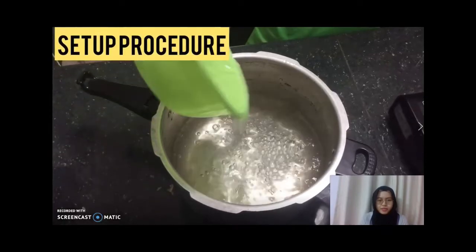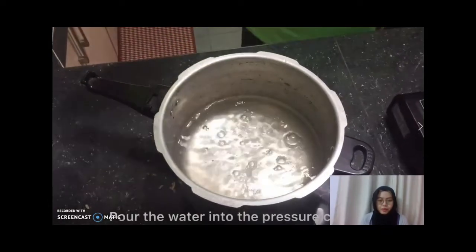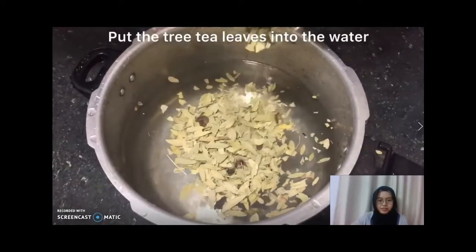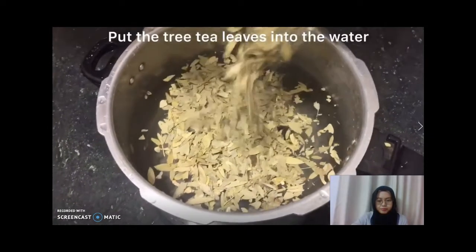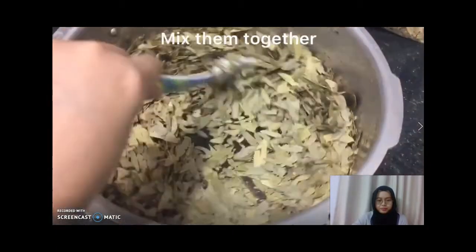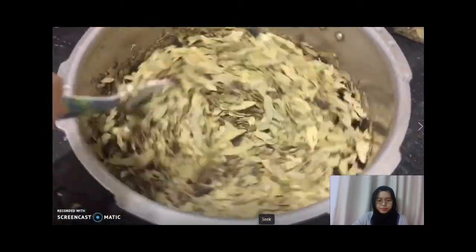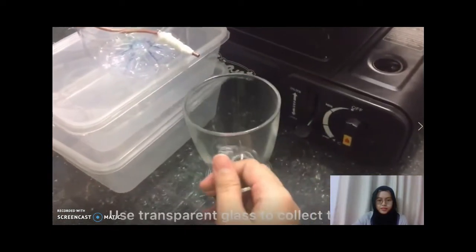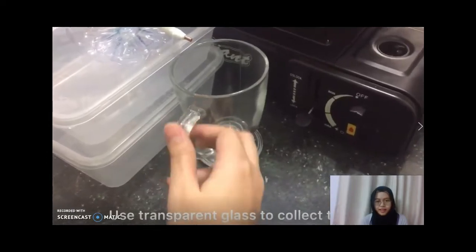So this is the setup procedure. We're going to pour the water into the pressure cooker together with the tea tree leaf. Then mix it together. So this will be our tank to collect the oil.